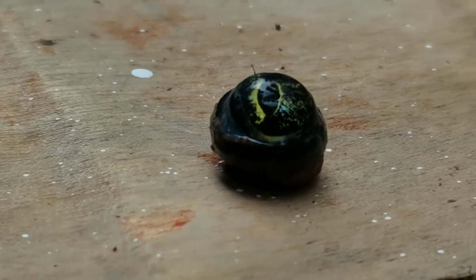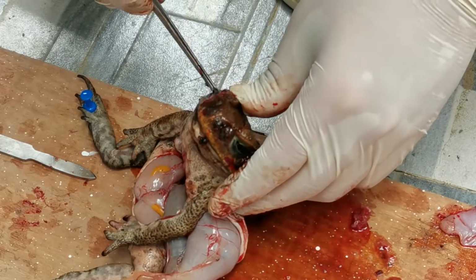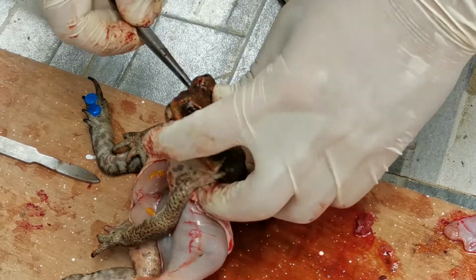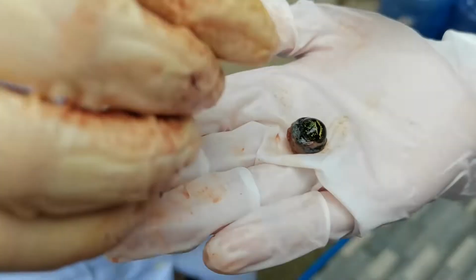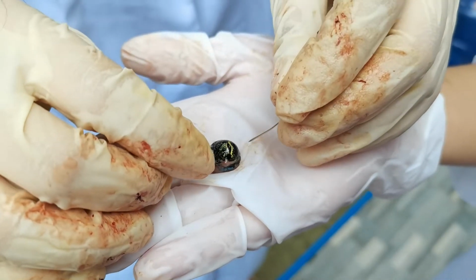The lens of the eye in a living frog is crystalline and transparent. With the scissors, carefully dissect the eyeball. Remove the spherical lens. Place the lens on your palm and hold it up to the light. Note that it gathers light, even in its preserved condition.